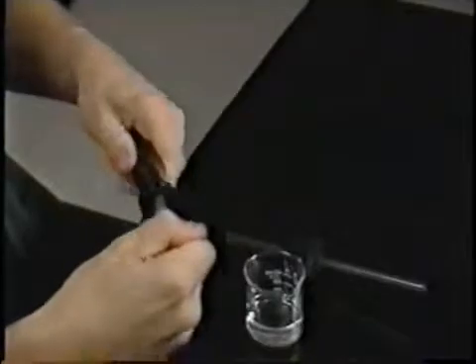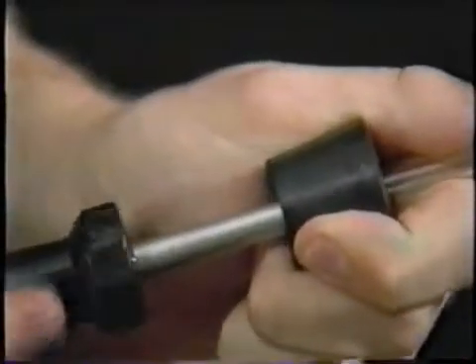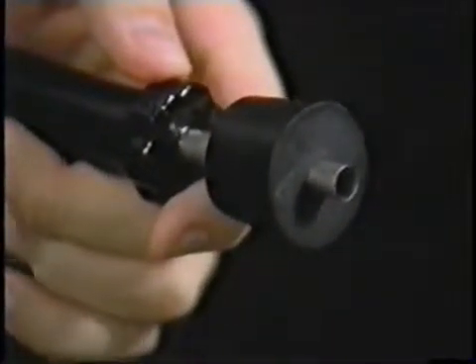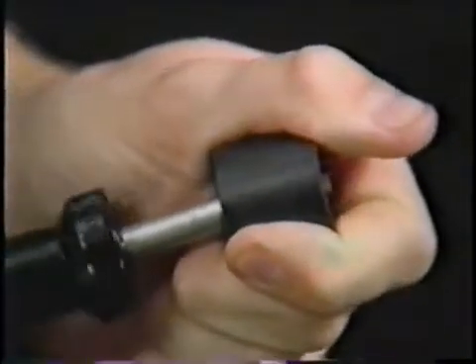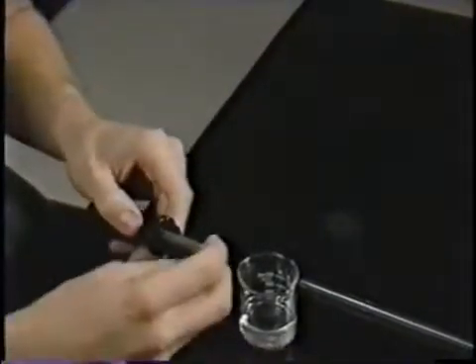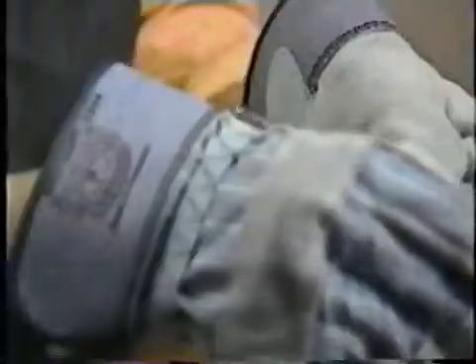To remove the tubing, take out the tip and lubricate the end of the hollow shaft. Push it through the stopper hole around the tubing, then slide the tubing out through the shaft and remove the inserter. Remember to wash the lubricant off before returning the stopper and tubing to storage, and don't forget to replace the tip.